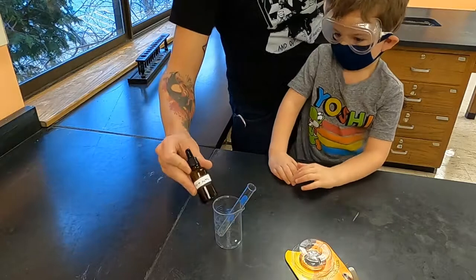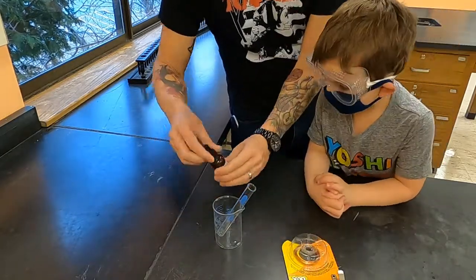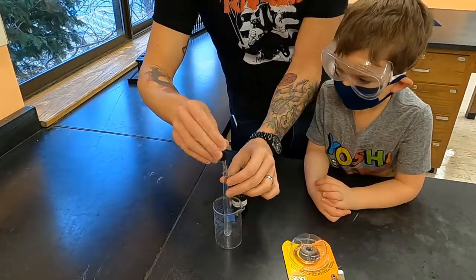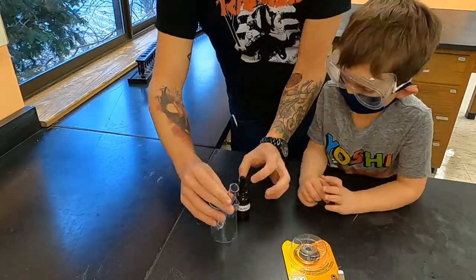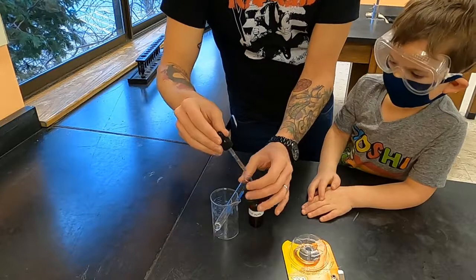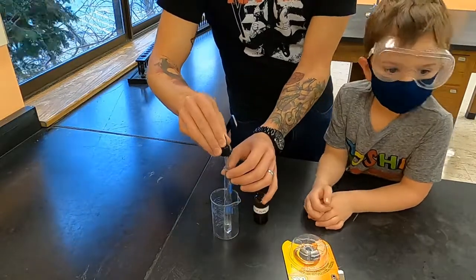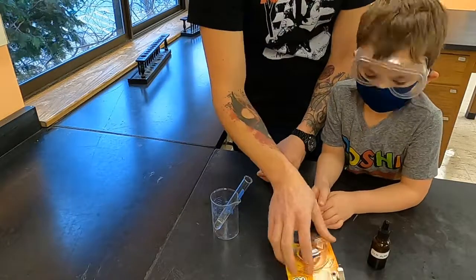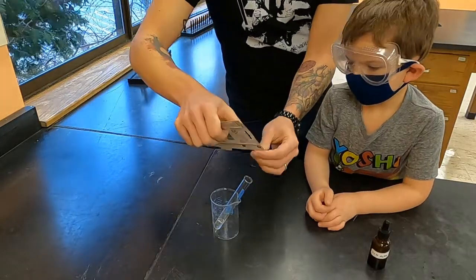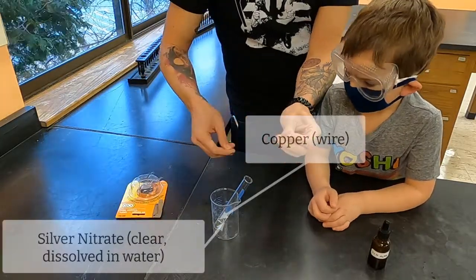This is a reaction between silver nitrate, which is dissolved in water, and a piece of copper, which is going to be a copper wire. You need to be careful with the silver nitrate. It stains clothing and skin. It'll stain skin for about a month, and in that month, the skin smells like dirty pennies. So you're going to put in just a small amount, and then a small amount of copper wire.